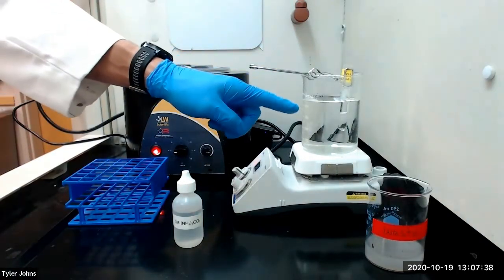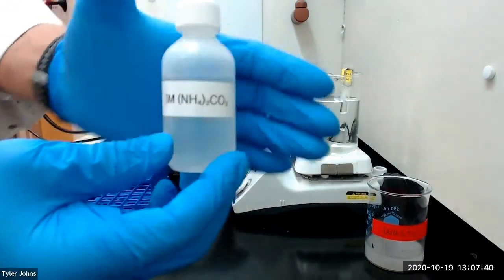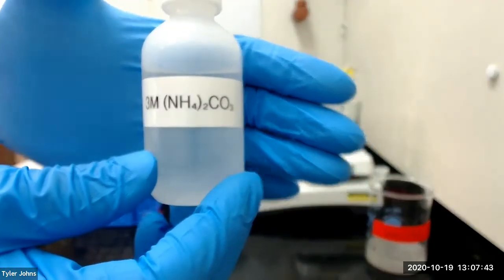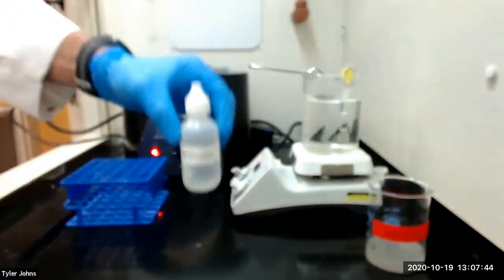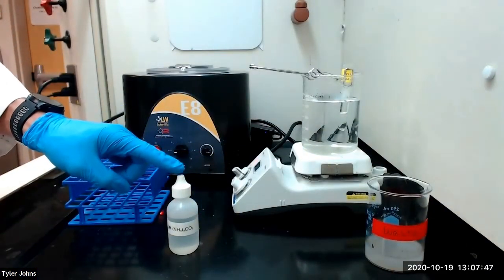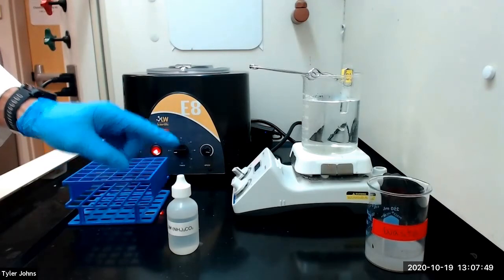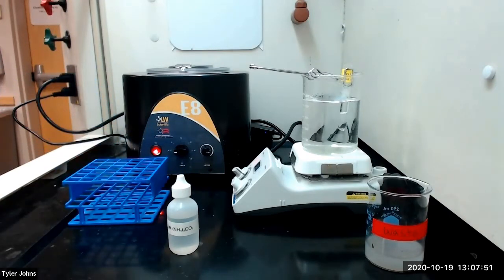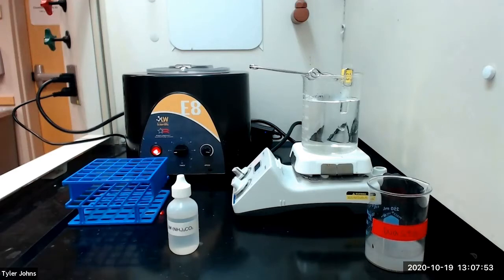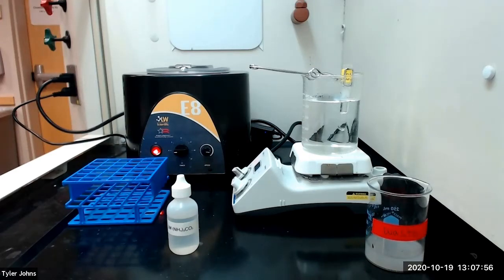To our hot solution we will add three molar ammonium carbonate dropwise until just basic. We will then add one milliliter in excess of three molar ammonium carbonate. We will mix the solution well and let it stand for five minutes to complete any precipitation. We will then centrifuge our solution.